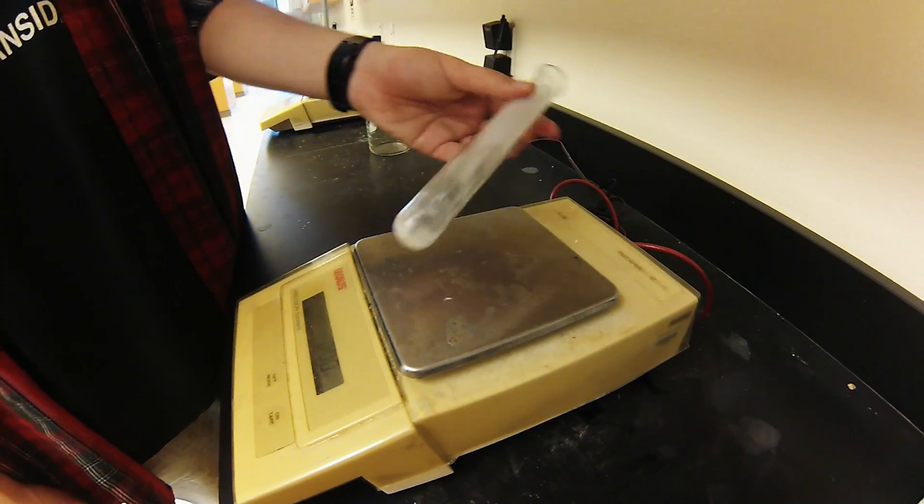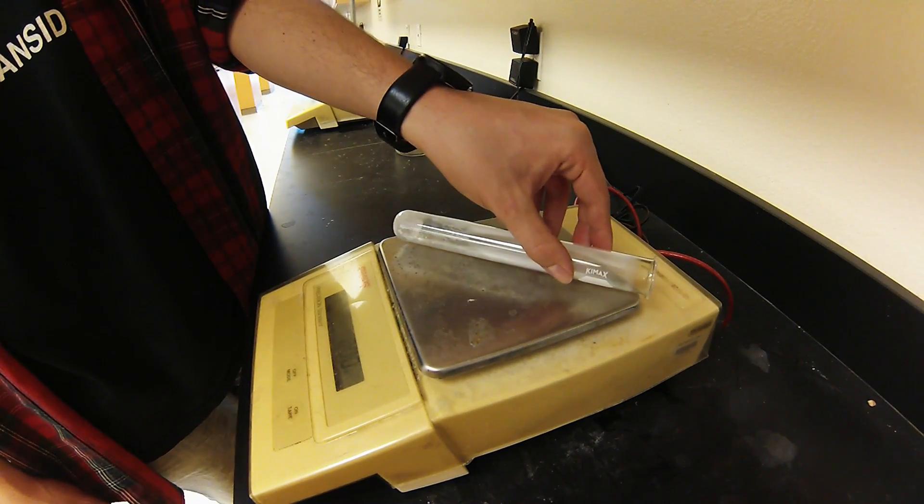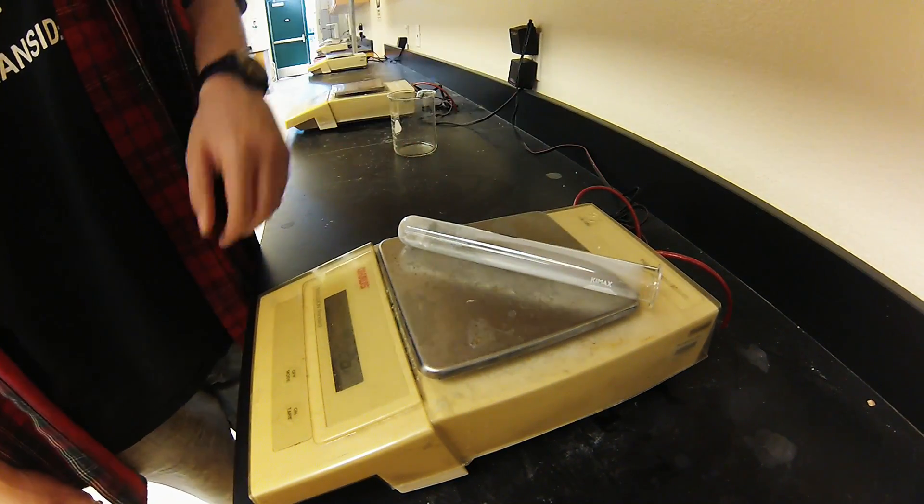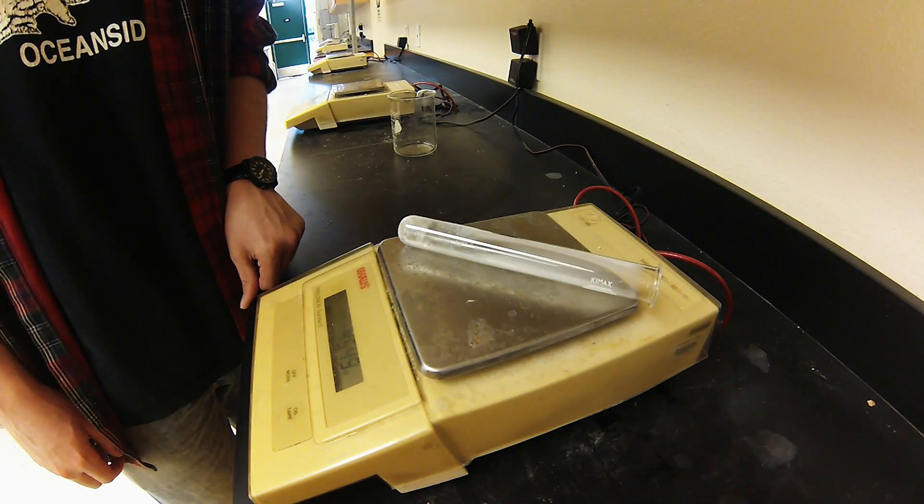After we take our product in our test tube, we're going to weigh it a second time to determine the new weight.